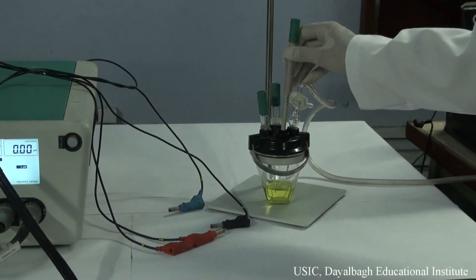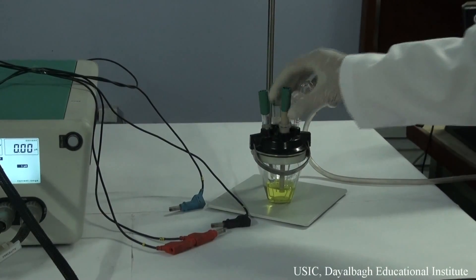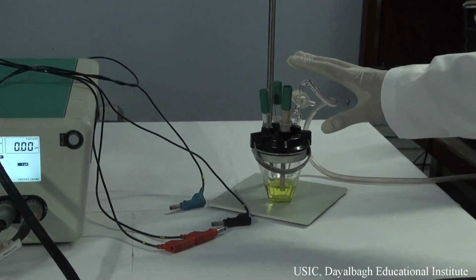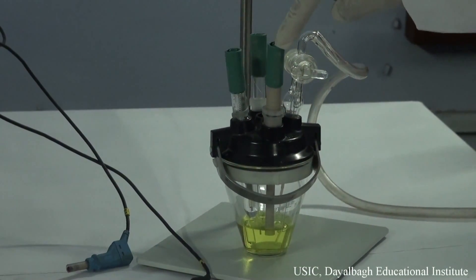Now this electrode has been put into the solution. Now we have a three-electrode system: the reference electrode, the counter electrode, and the working electrode.